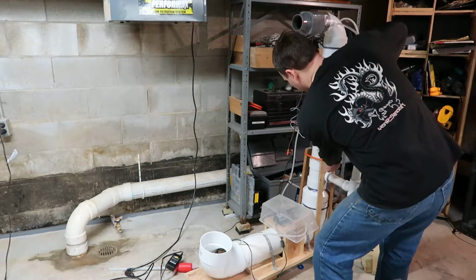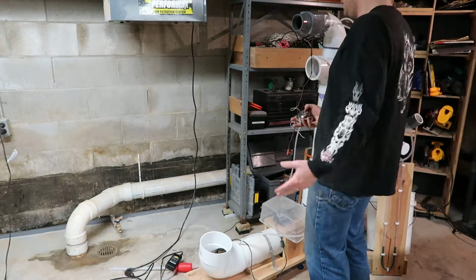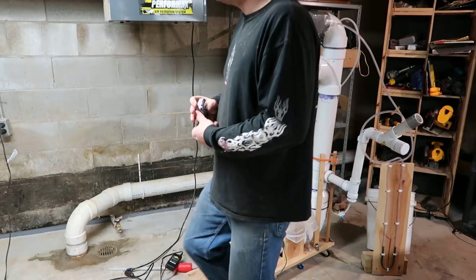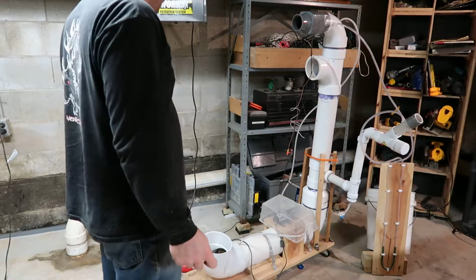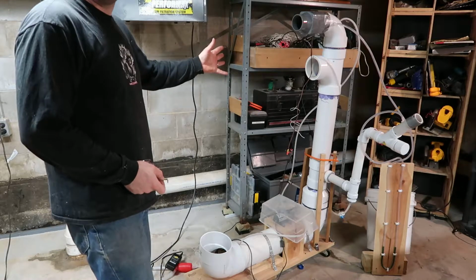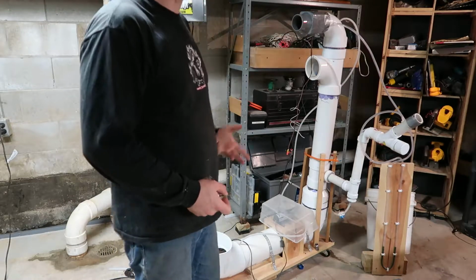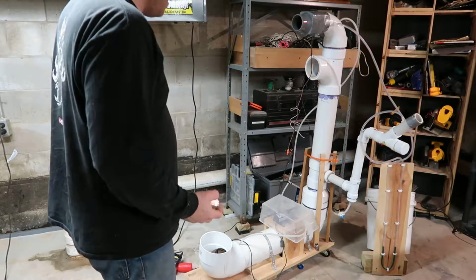For example, I have roughly 22 inches of packing. That is kind of an arbitrary number. I've seen some of the lab scale scrubbers that they use, and they don't use a heck of a lot more packing than that, although they're obviously certified to destroy X amount of material passing through them. Also, this has been jankily set up. It doesn't have real caustic in it, it just has water for the moment. This up here, the vent would normally go somewhere instead of to here, the same space I'm in.